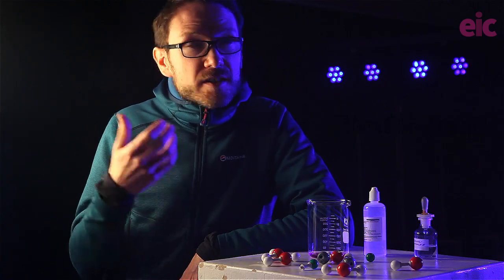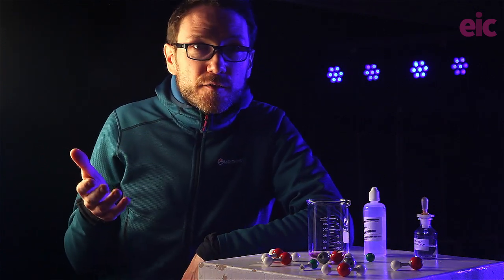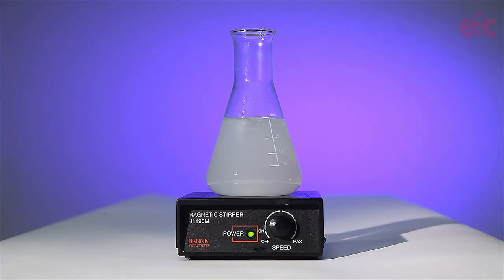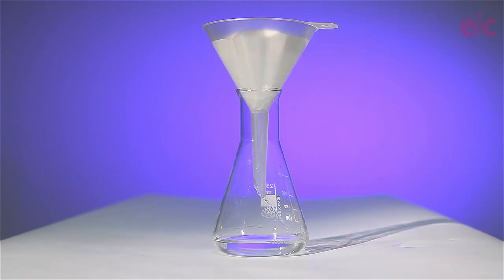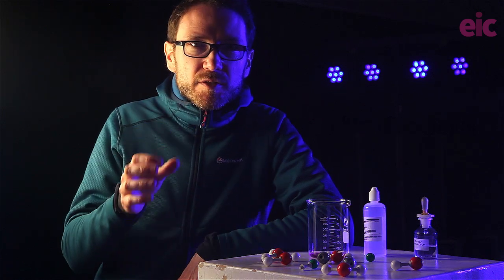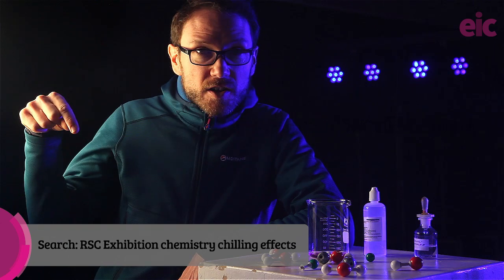I've used barium hydroxide octahydrate to make up my solution. The classic recipe can be a bit of a faff due to its propensity for forming carbonates, but there's no need to go through the rigmarole of boiling water and using guard tubes for this reaction to work nicely. Any insoluble solid can be filtered off and you'll still get a solution close in concentration to the bench acids you have to hand. Be aware that the main use of barium hydroxide may be to show its endothermic reaction with ammonium salts — we've covered that demo in a previous column.